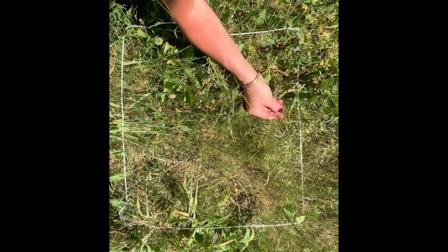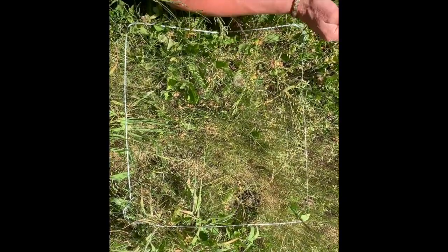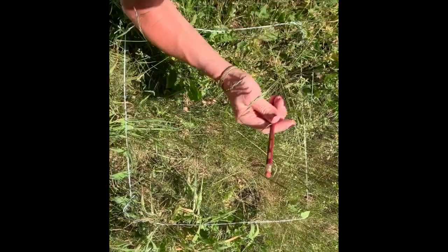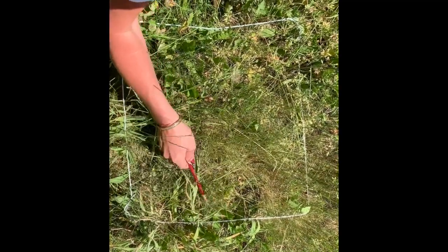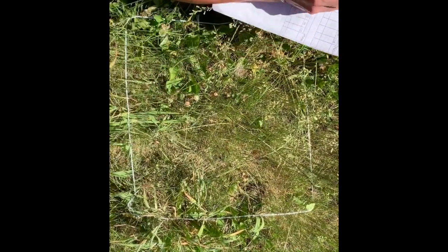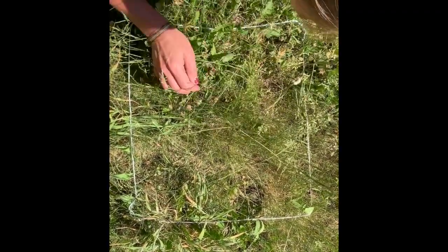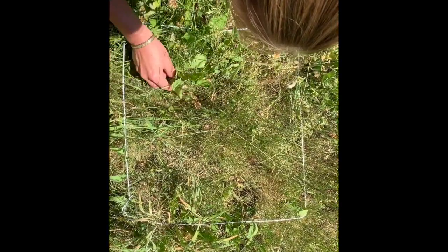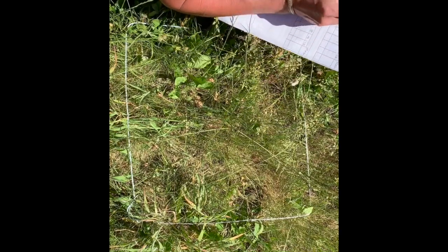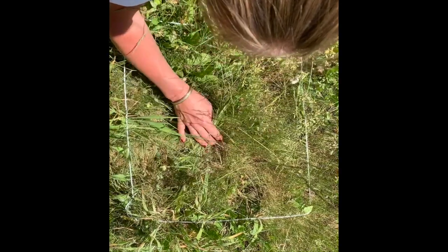Quadrat 2 then, there's this one, so that's one of them. There's obviously dandelion here. There's the normal grass. No, that's not actually in the quadrat, even though the leaves are, it isn't, but this one is, and that's the same as that one. Is there anything else I can see? What's this one here? Oh yes, that one's different, I think. Yes, there's clover down there. That's 5.